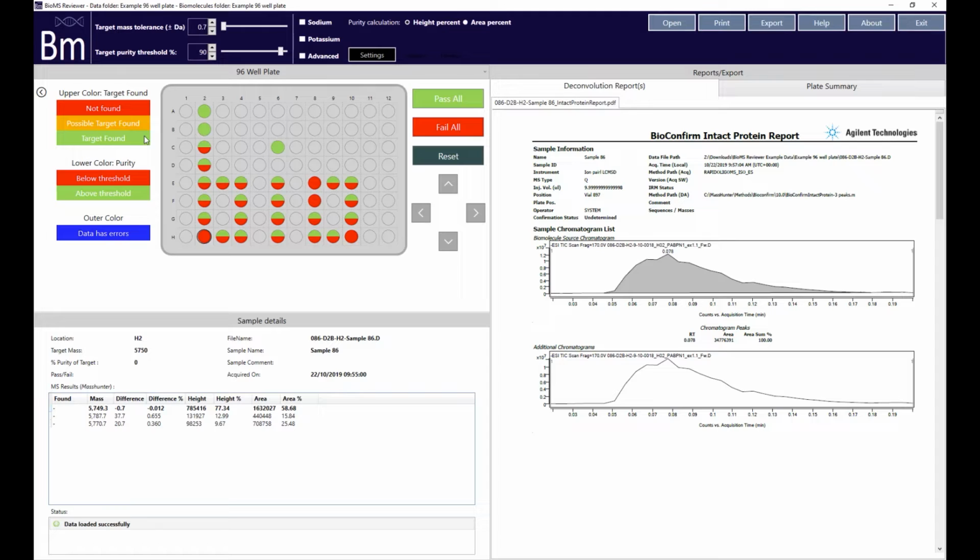BioMS Reviewer uses a mass window provided by the mass tolerance box and slider to determine whether the target mass for each sample could be matched with a biomolecule from the deconvolution process. The lower half of each circle represents what percentage of the peaks in the MS data can be attributed to the target molecule.